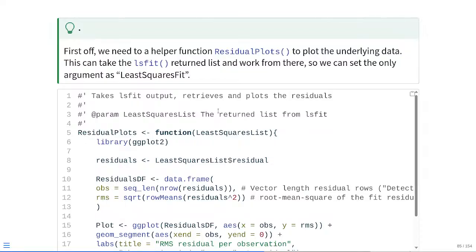So at this point, as we write out the Roxygen skeleton, we can see these are the elements. The parameter, as far as the argument, is going to be the least squares list, and then saying what it actually does.